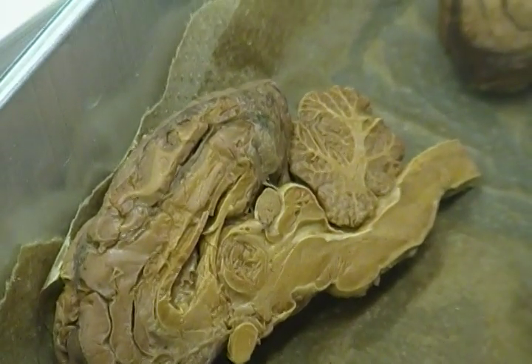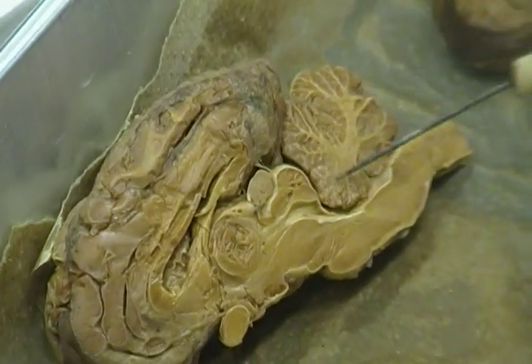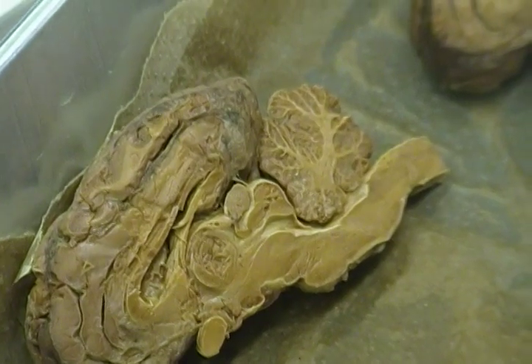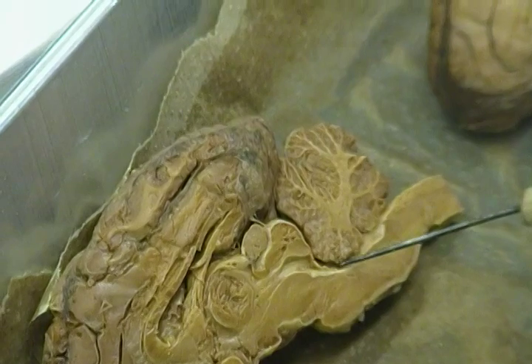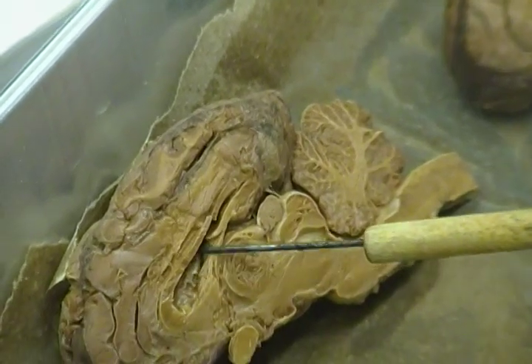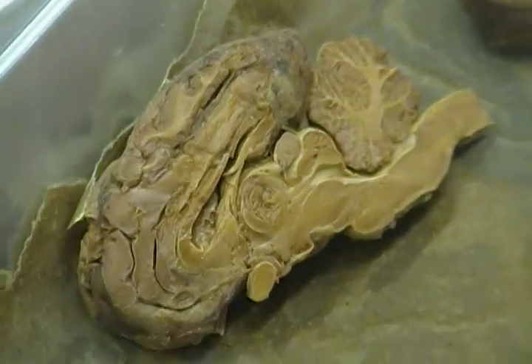Right. Now, right where it passes through between the cerebellum and the pons, it kind of widens a little bit. It kind of opens up a little bit. That's another ventricle. Which one is it? That's the fourth ventricle. So this tube is the cerebral aqueduct. We can see the fourth ventricle. This is the lateral ventricle, or one of them up here. Third ventricle's kind of hard to see, as I've mentioned before.